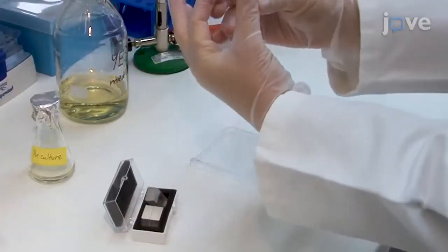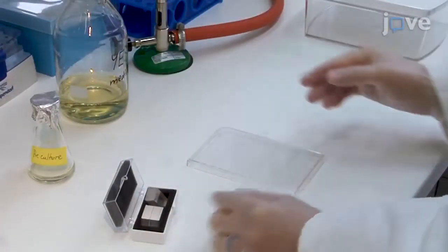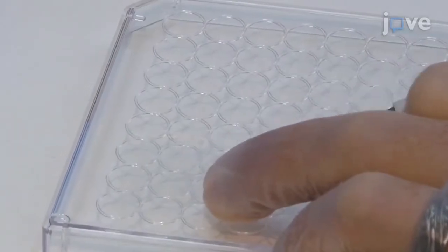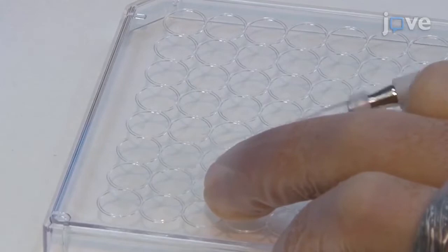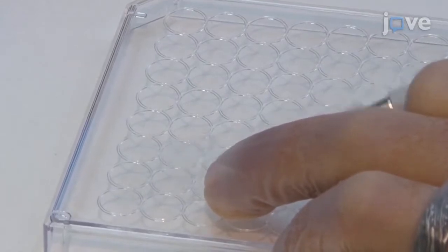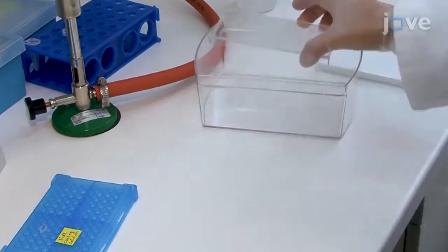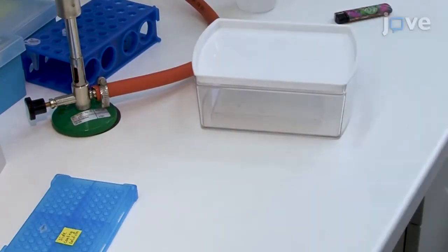Next, prepare a microscope coverslip for each sample to be imaged. Spread 1 µL of slide coating solution onto a clean coverslip using the long side of a horizontally positioned pipette tip. Allow the coating solution to dry completely and then store the coverslips in a dust-free environment.